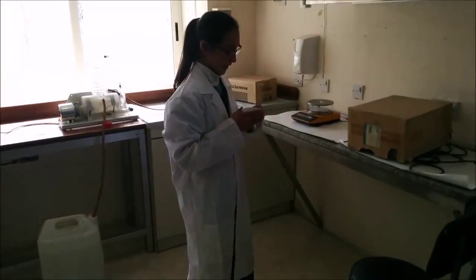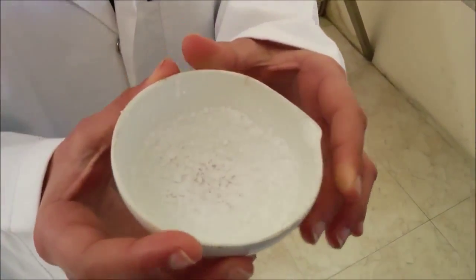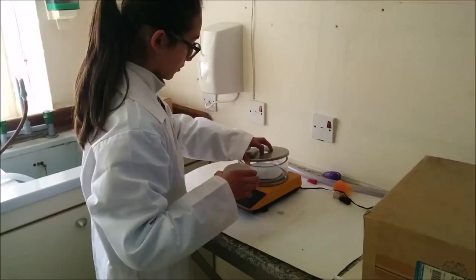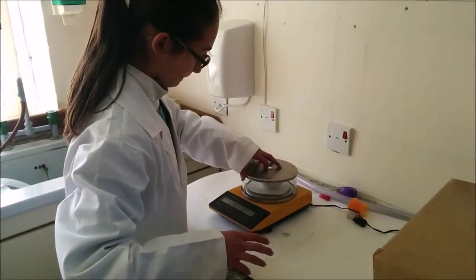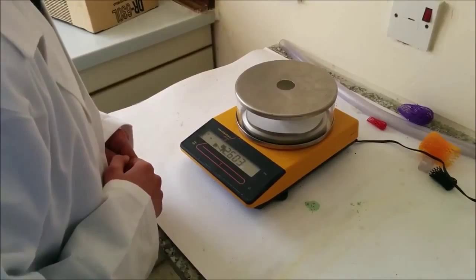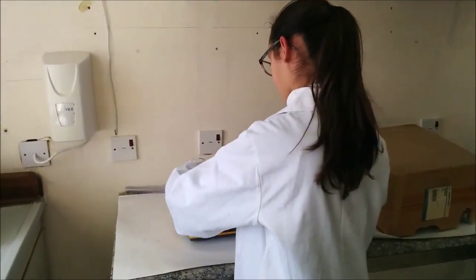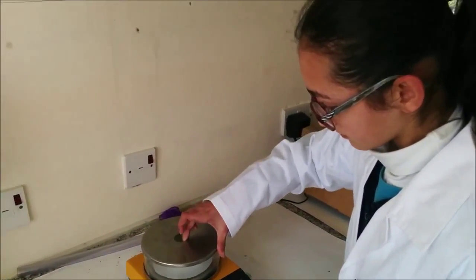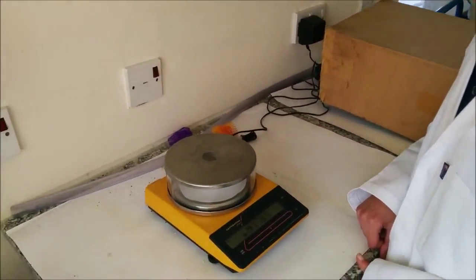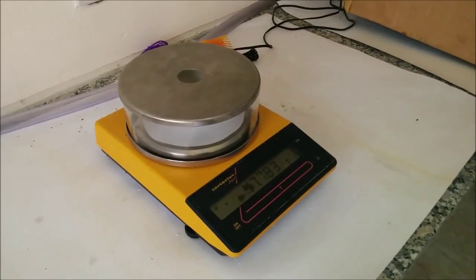After we evaporated the water vapor, a lot of salt crystals formed. Now I'm going to reweigh it. After evaporation: 42.603 grams. I'm going to do the same with the other evaporating dishes: 47.783 grams.